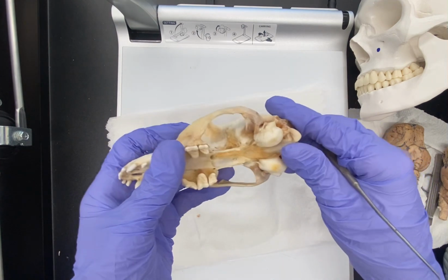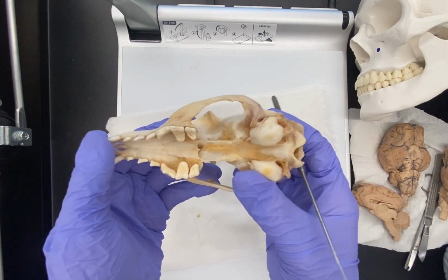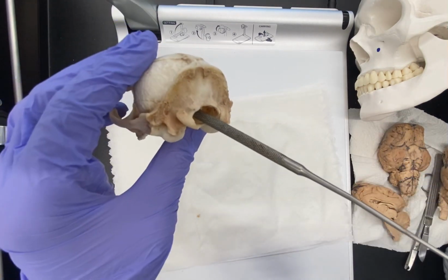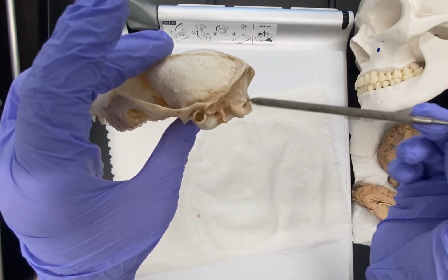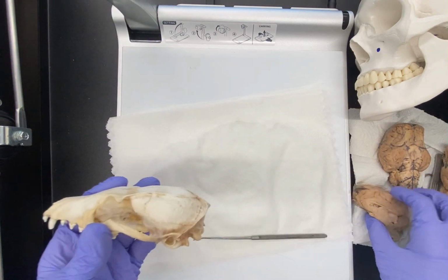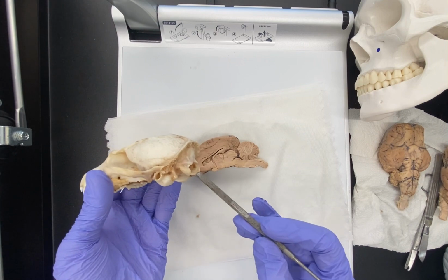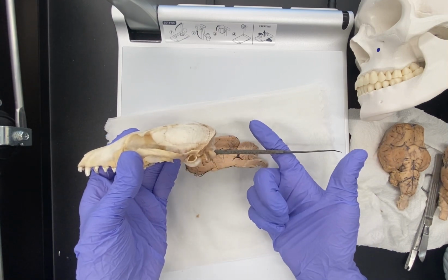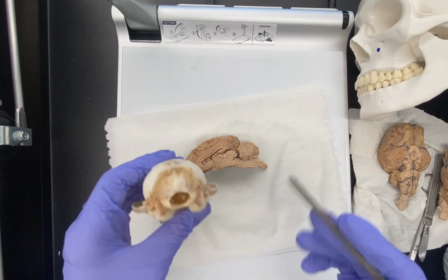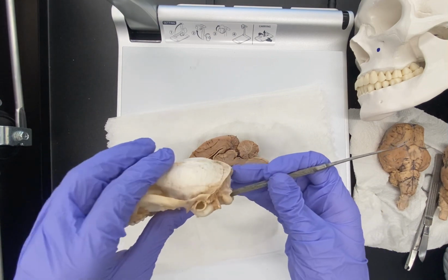And so if we turn this over and look on the underside, we don't see that opening. In the human skull, we found it here, but if we look more at the posterior surface, now we see that large opening. This is our foramen magnum here. And so that foramen magnum is oriented more at the posterior side of the skull. And again, that would help accommodate a more horizontally oriented brainstem and spinal cord coming out the backside of an animal that walks on four legs as opposed to two. So again, this is a sheep brain, this is a fox skull, so the brain and skull don't match, but the comparison of how the brain and spinal cord is oriented compared to the foramen magnum still holds true.